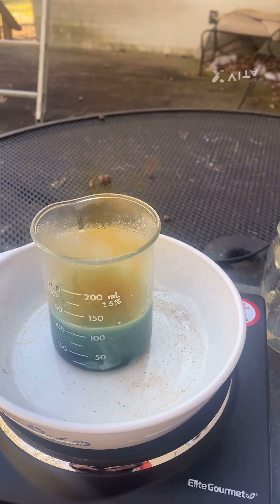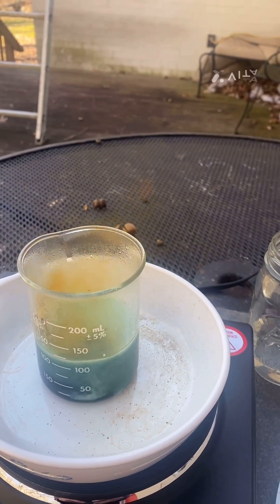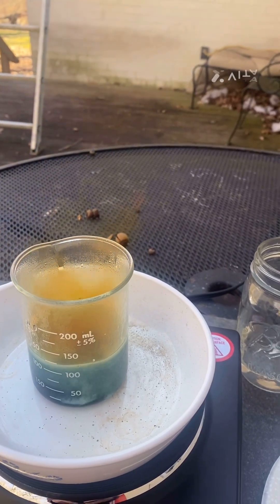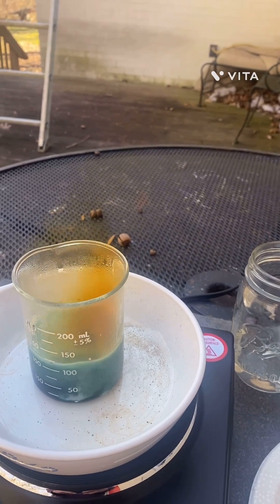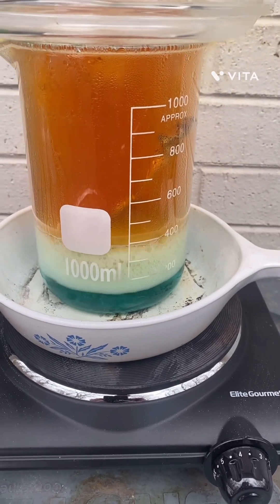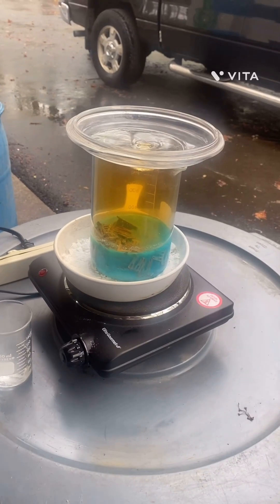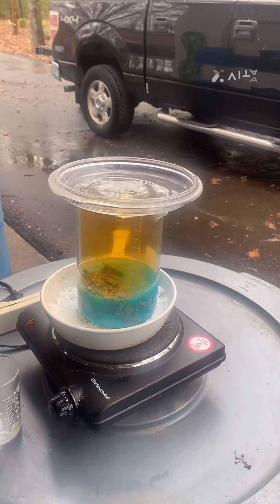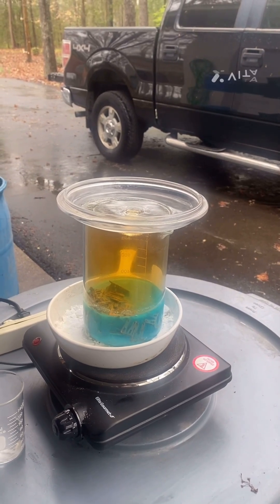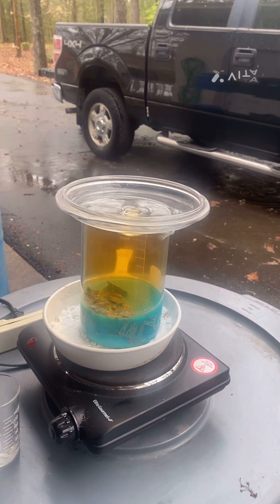77 grams of silver alloy and 45 milliliters of distilled water, 40 milliliters of 68% nitric acid. Turn the heat off — vigorous reaction. Nitric acid and distilled water. Here we are with Saturday morning rainy day chemistry for Carolyn Wright, coming to you from wonderful Aslin, Virginia. I've got to add a little bit of water to this.